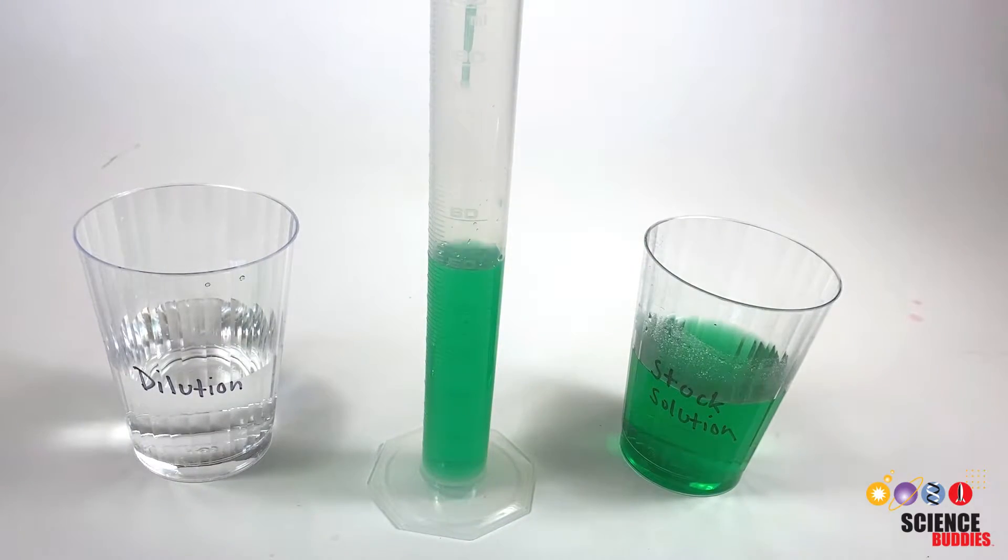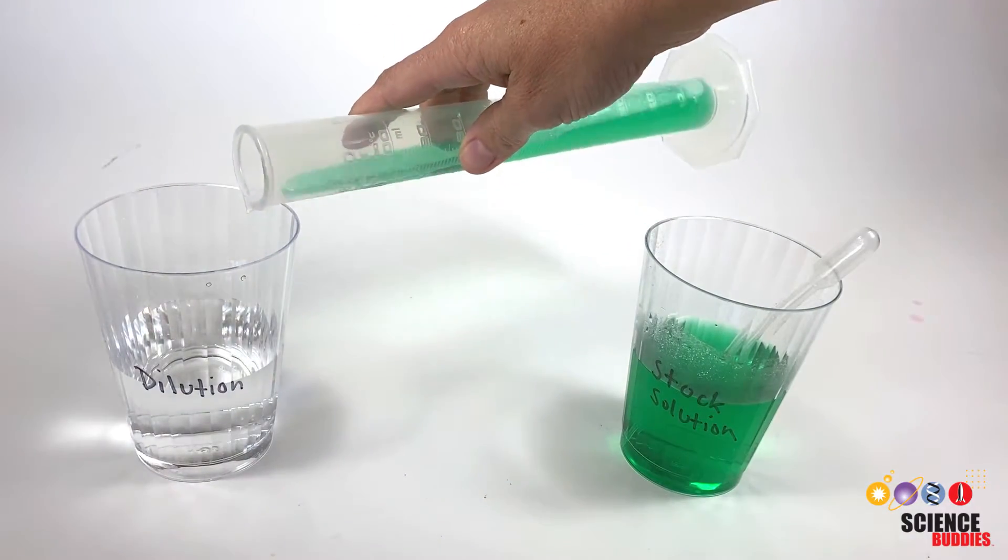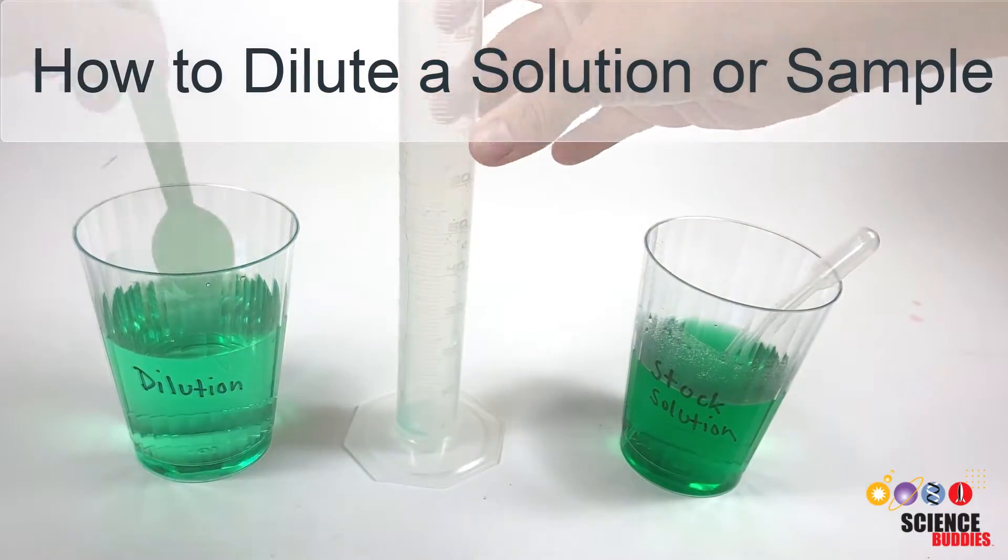Hi, I'm Svenja Lohner from Science Buddies and in this video we will show you how to dilute a solution or sample.